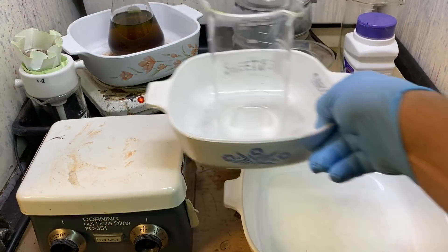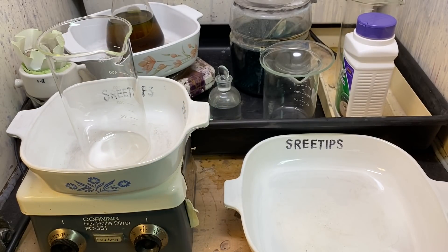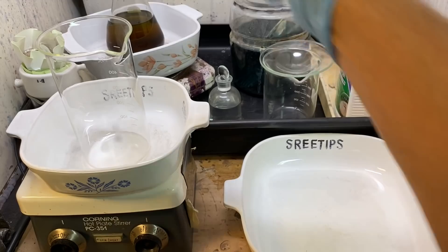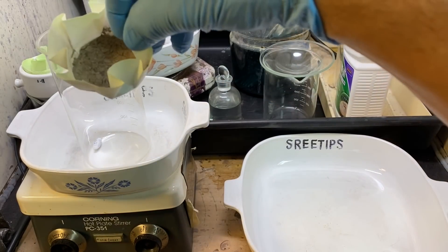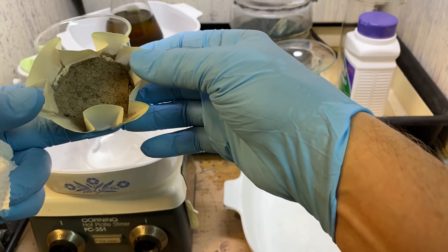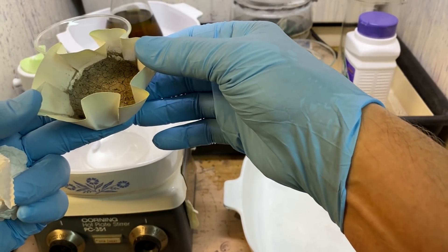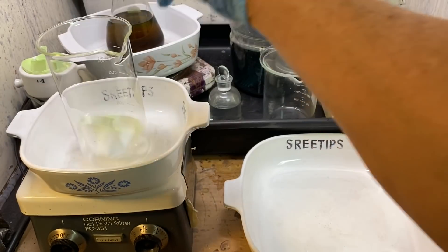Welcome back to part eight. Some viewers suggested putting these filters with our solids and some aqua regia to see if we can get some more gold out of it. I don't think this is going to be successful, but I'm going to try it anyway.